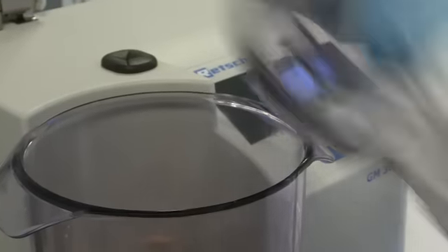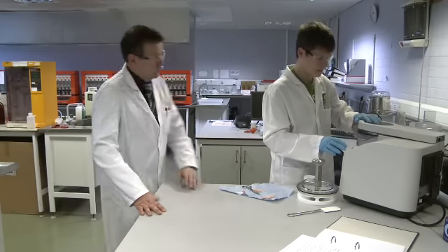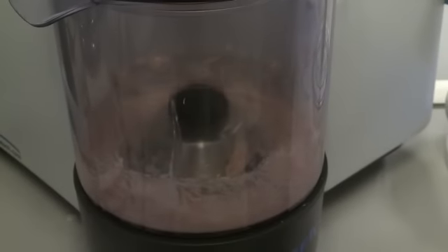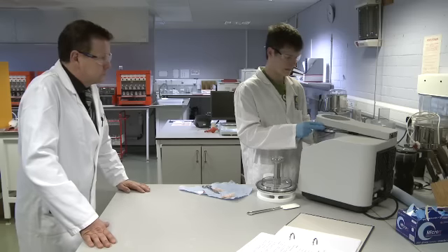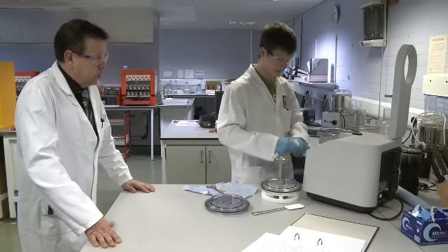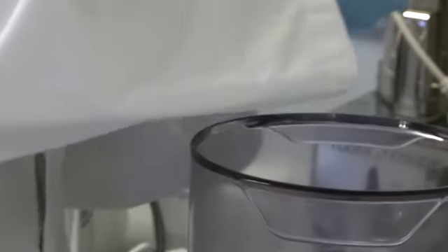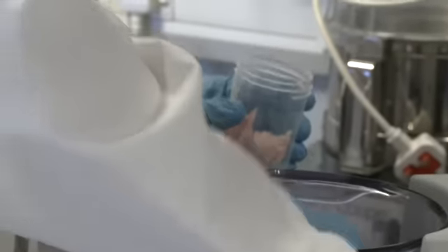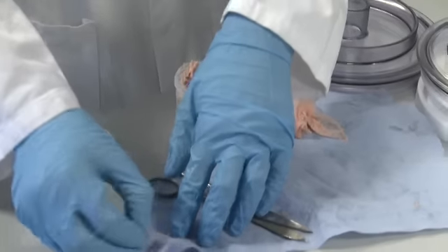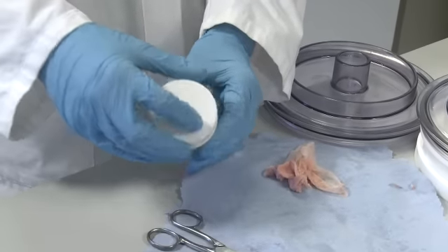Nicky's now putting it in the blender, placing the lid on. The safety lock engages and the revolutions start. The sample is now removed and we'll put it in a clean, fresh vessel for each sausage and uniquely labelled. The unique barcode label will now be placed in the sample. The process is now ready to move on to the next stage.